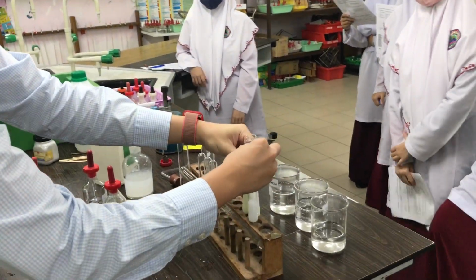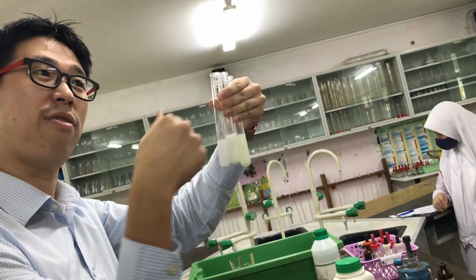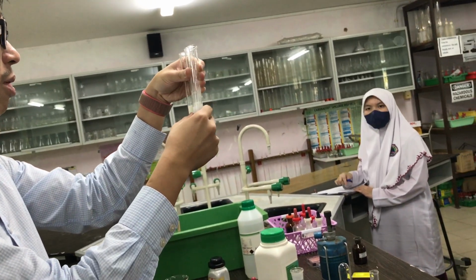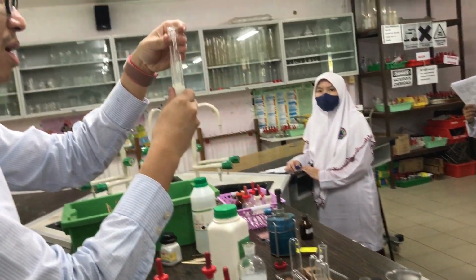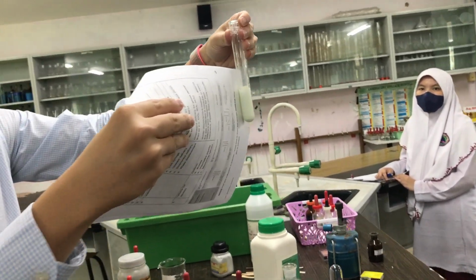So in that order, it was on the left, it was chloride, precipitate out as silver chloride because you have added nitric acid and then you have added silver nitrate. So now what you get is silver chloride. What is the observation? White precipitate. These two are quite hard to see. Usually it is easier to see. Let me borrow your white paper. See the difference? Very slightly.